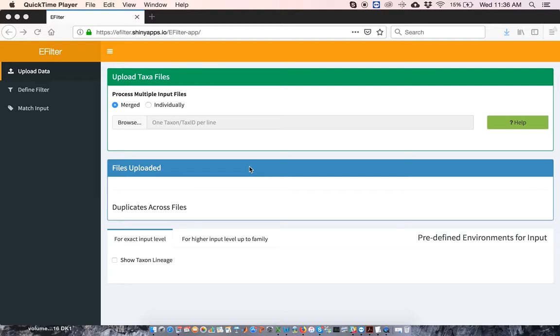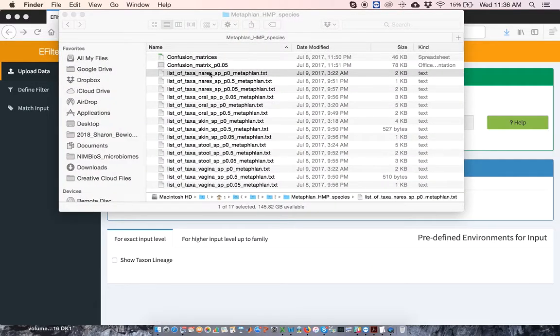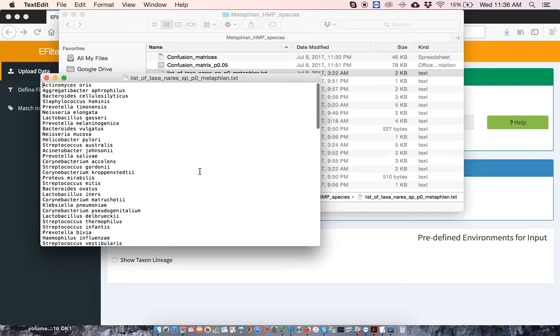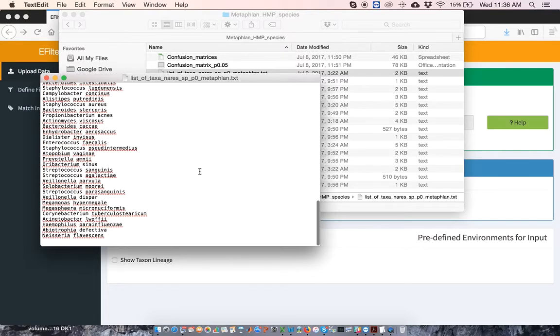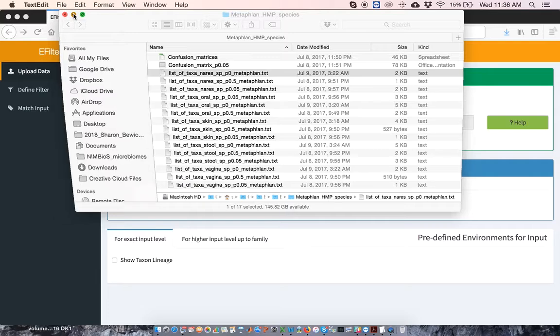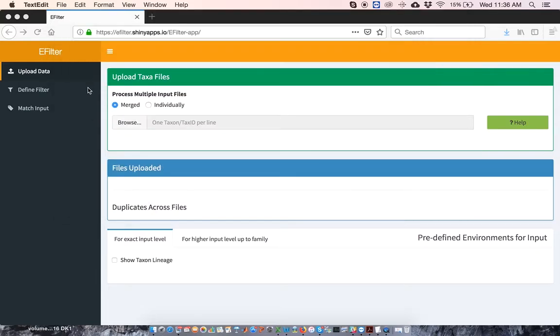EFilter automatically assigns taxonomic rank to tax IDs or Latin names. Here's an example of input files with species name. In general, we've tried to make EFilter as user-friendly as possible, which means that you can run EFilter on a point-and-click basis. The first choice that you need to make is whether to analyze your files separately or as a single pool. The default is to pool files, but I'll choose to analyze them individually because it provides a little bit more information. To do that, I'm going to click on the Individually radio button.